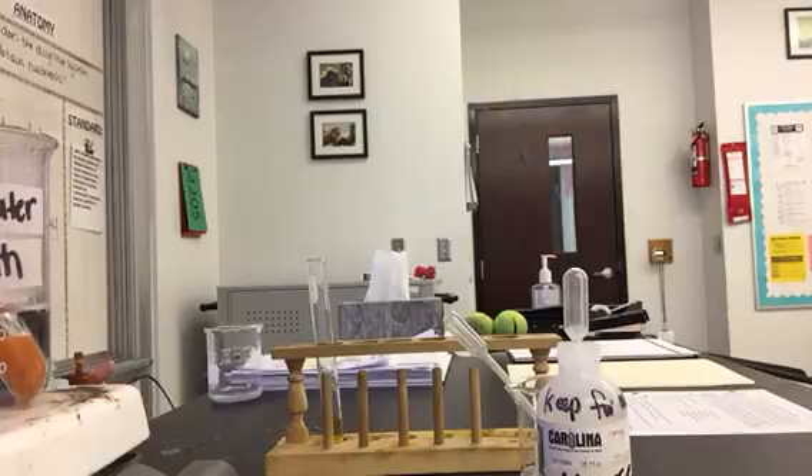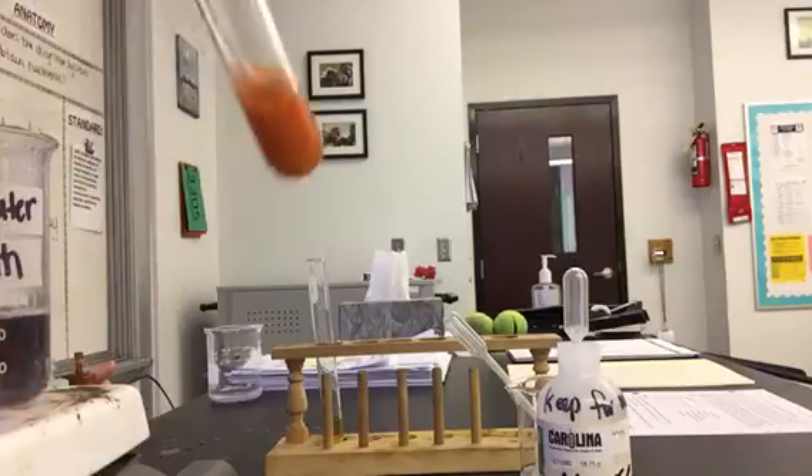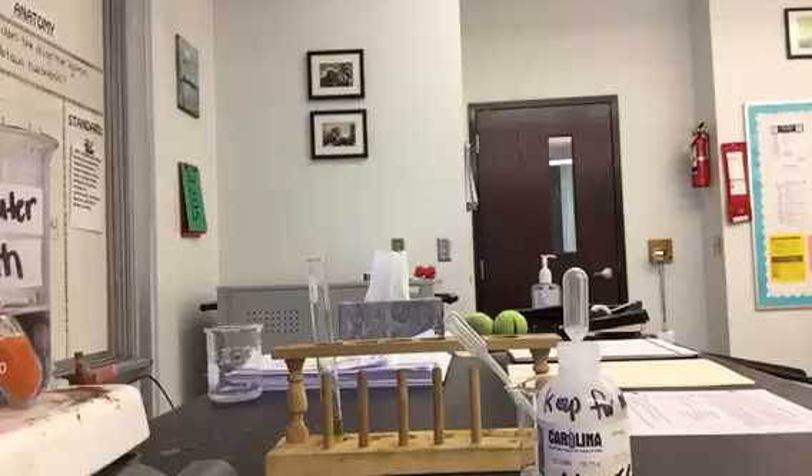It's up to you to decide why one left the baggie and the other one didn't. This is nice and bright orange now, almost red. Think about that and try to relate it back to your intestines, and think about why it's important to break down molecules from a carbohydrate like starch to a monosaccharide like glucose before it's absorbed by the body.